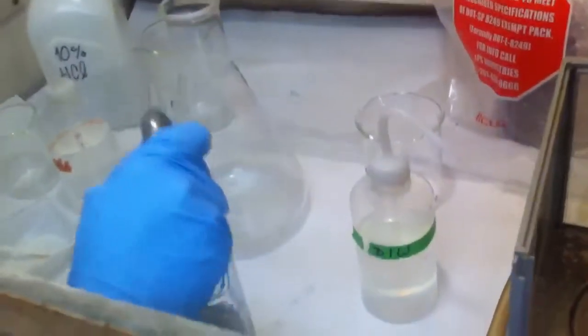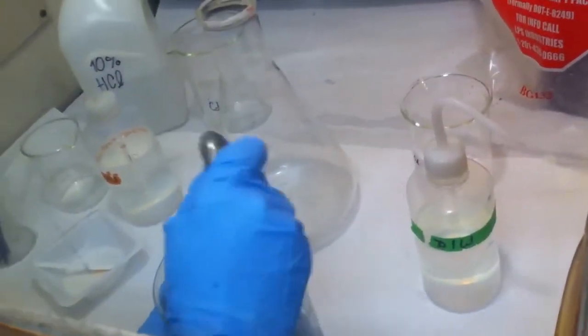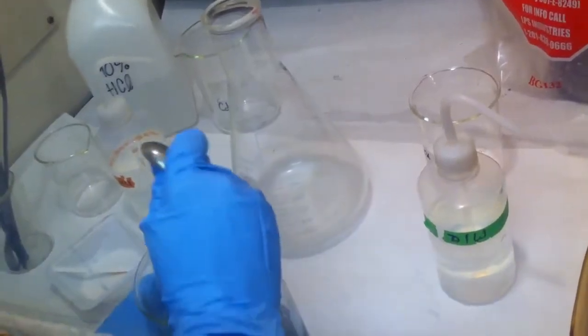So while I continue to stir even more, I'm going to start rinsing it with DI water.